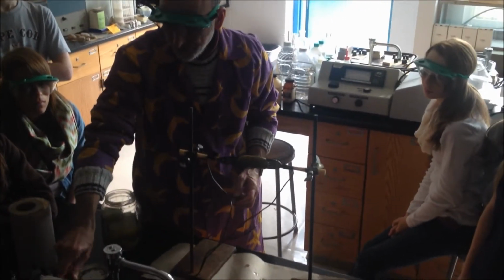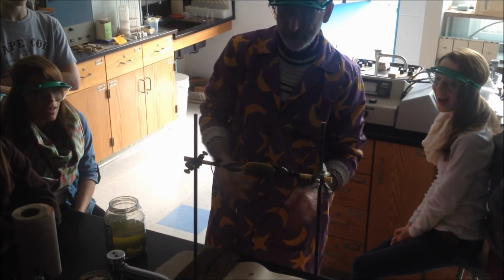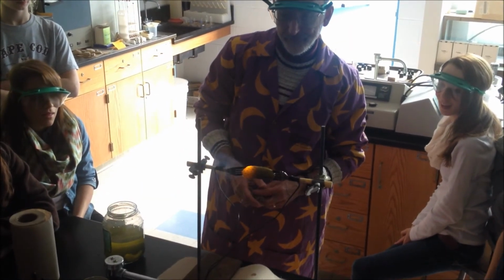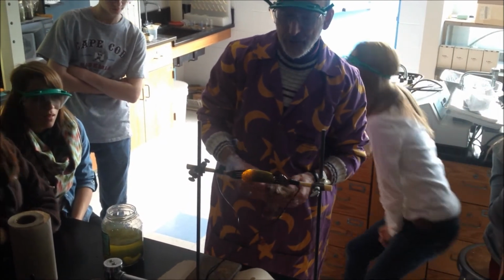Okay, ready? Okay. It's on fire. So there's the characteristic yellow color of a sodium flame.